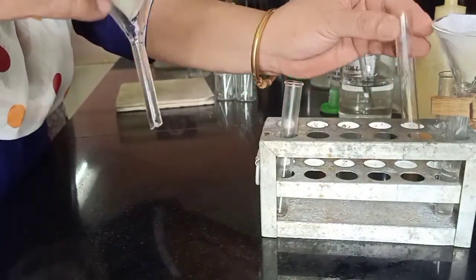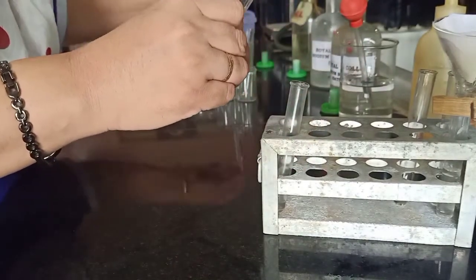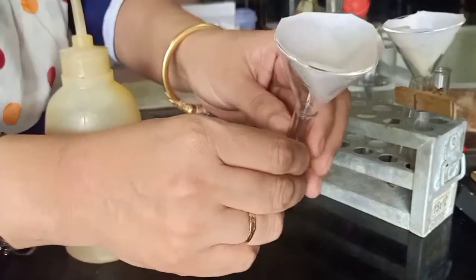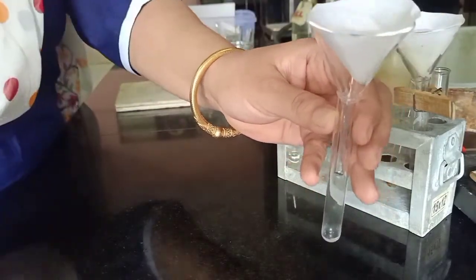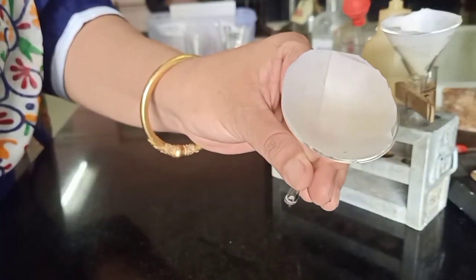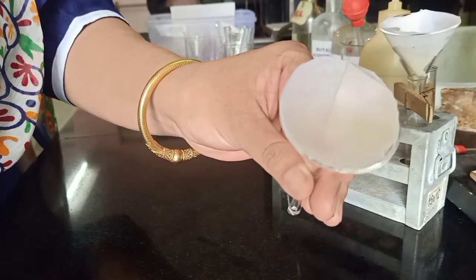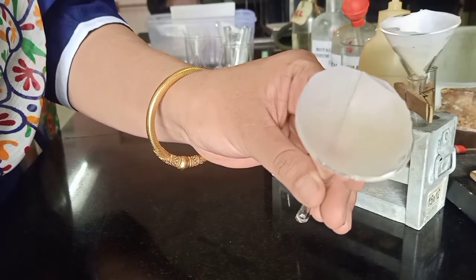Now that we know phenol is absent, let us proceed with the residue. We will now proceed for the test for a base. Before we proceed, we need to wash — washing with NaOH is not required since phenol is not present, so only washing with water should be enough. We have now obtained a white residue after washing. We got phenol absent, there was no re-precipitation. We also checked the medium for acidity and still there was no re-precipitation, so we assume phenol is absent. We will now proceed for the test for base with this residue.